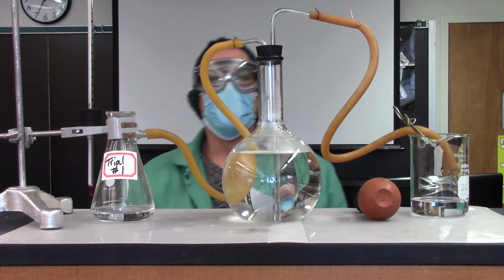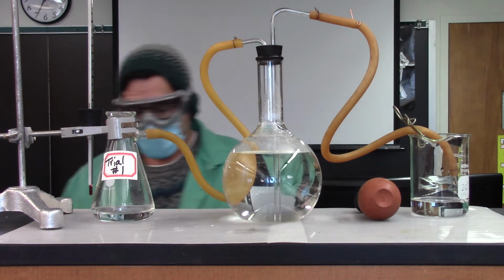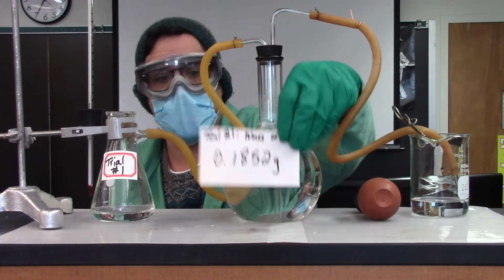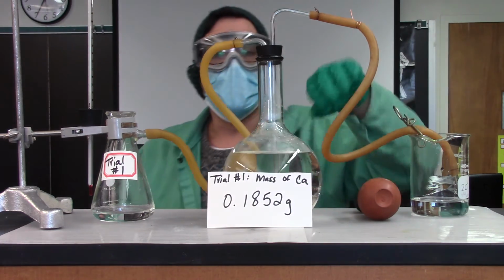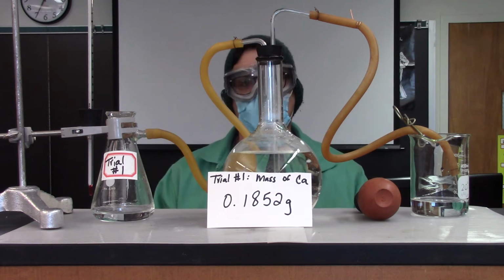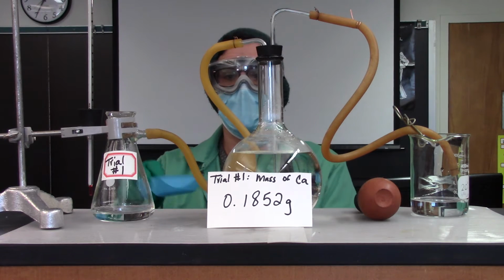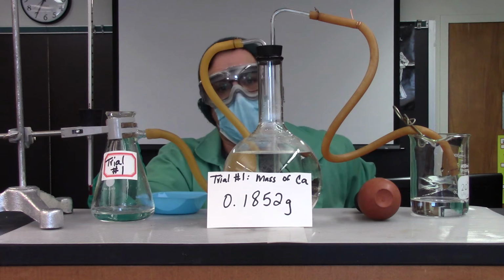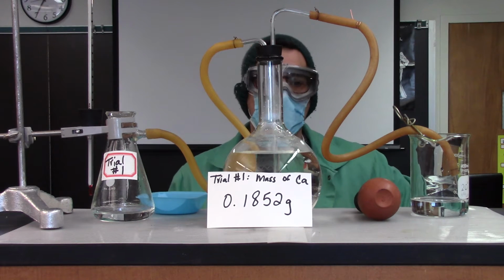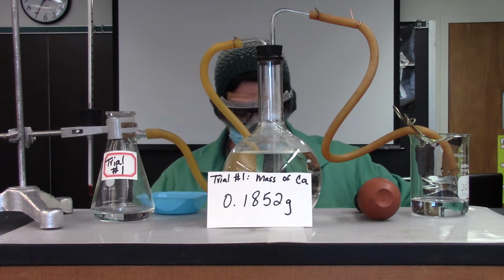Can begin the reaction. So what I'm going to do is put in this, now I pre-weighed this mass for you all. I'm going to be putting this in to react with 25 milliliters of the acid. This is in excess. And then what we'll do is titrate to see how many moles of HCl reacted. And that's how we'll find our ratio. You'll find the moles of the calcium used using the formula weight.